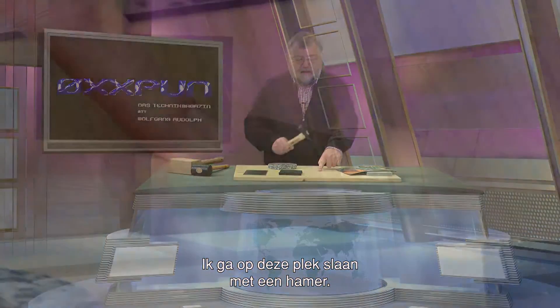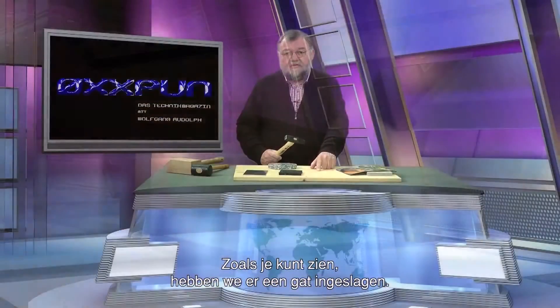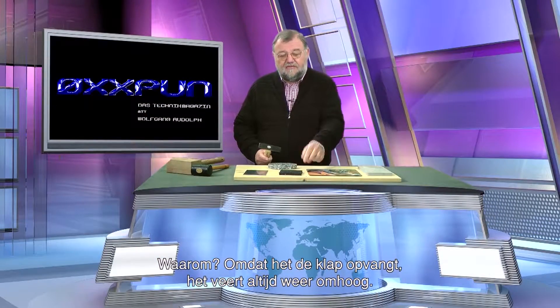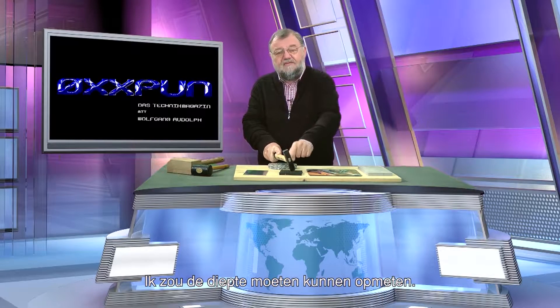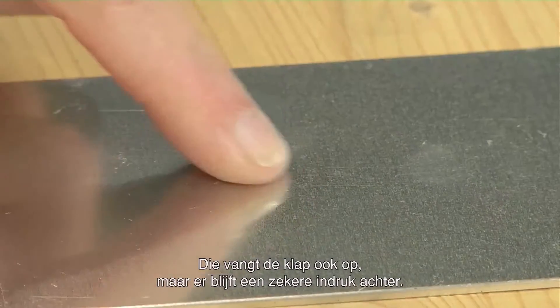That works pretty simply. Here I will hit it, now with a hammer. And as you can see, we have hit a proper hole into it. The penetration depth is a measurement for the hardness. You might say I will hit my shock-absorbing material — but that doesn't work. Why? Because it cushions; it always comes back up. I can feel a little dent in it, but that isn't what I want. When it is penetrated, I should measure that deepness. With metal it works too — it cushions too, but a certain deepness stays.